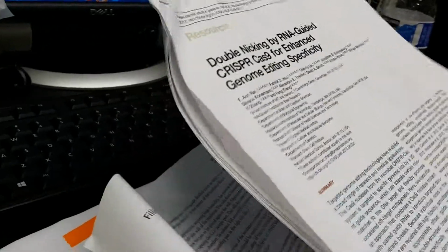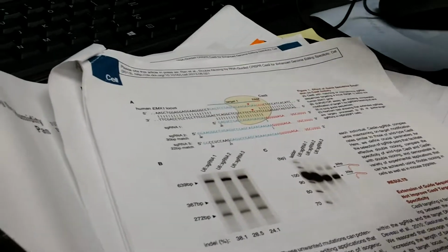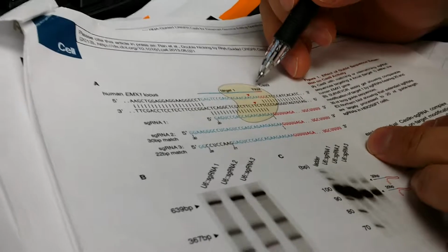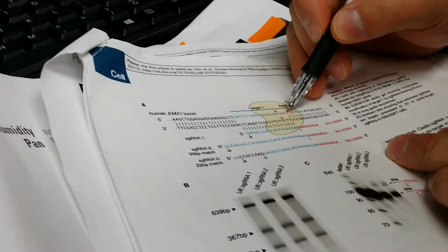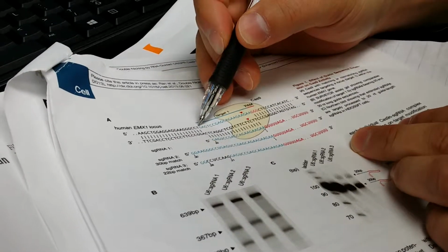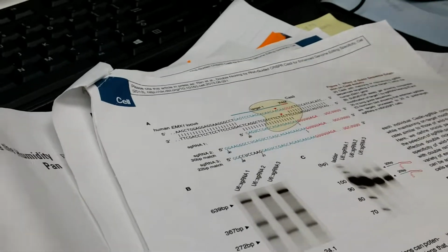Oh, I see. So this is the principle for designing the CRISPR. You have a gene, and then you want to target a sequence. The Cas9 recognizes a PAM sequence, right? The PAM sequence is NGG. So this is GNGG, and then before this, you just find the 19 base pairs. So you hunt for NGG. You just find your gene which has NGG.